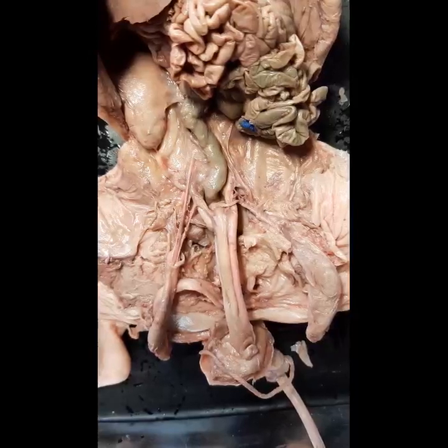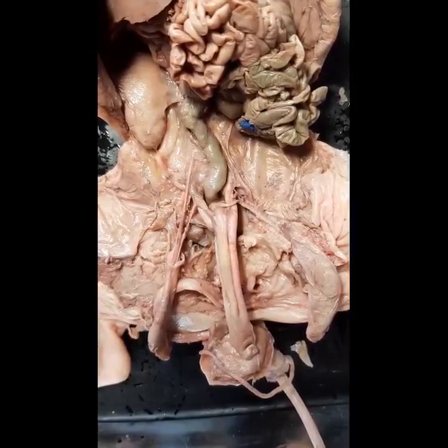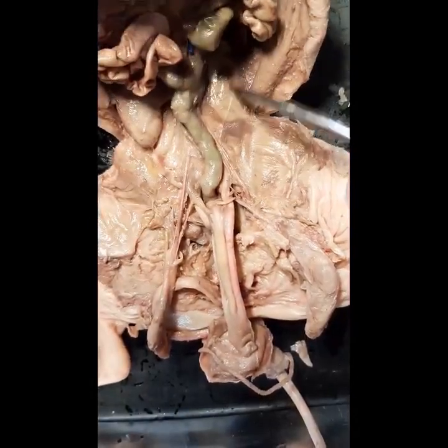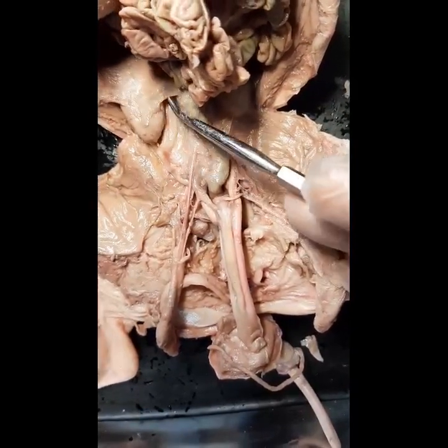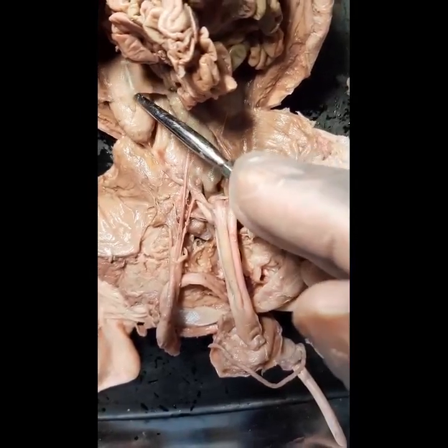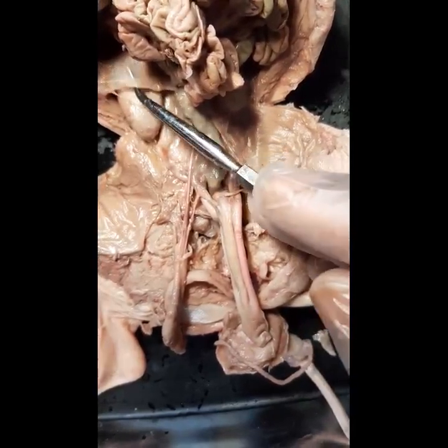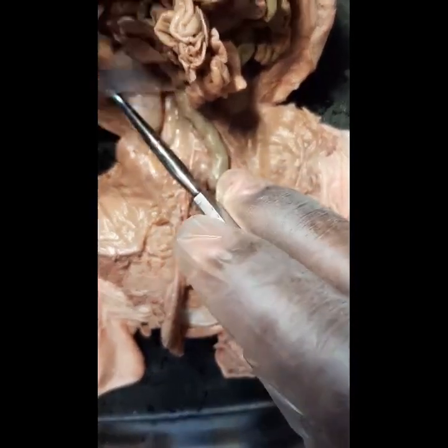This video is covering the male urinary system of the male fetal pig. We begin with the kidneys — we have the right kidney and the left kidney. These kidneys are retroperitoneal because they are behind this parietal layer of parietal peritoneum.